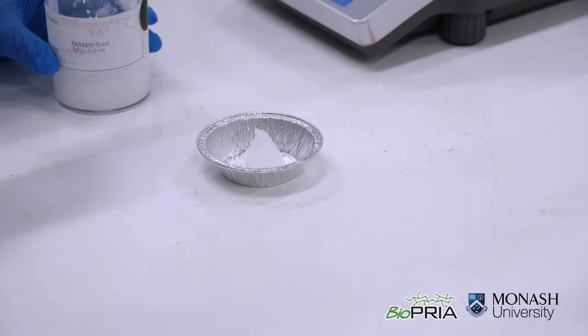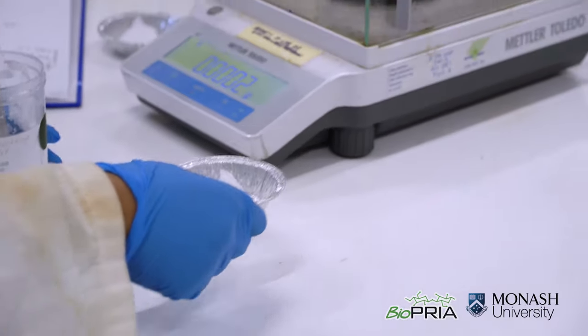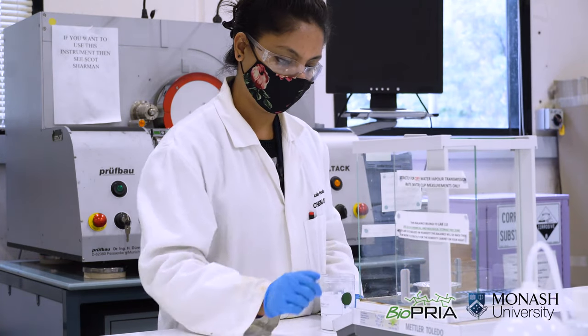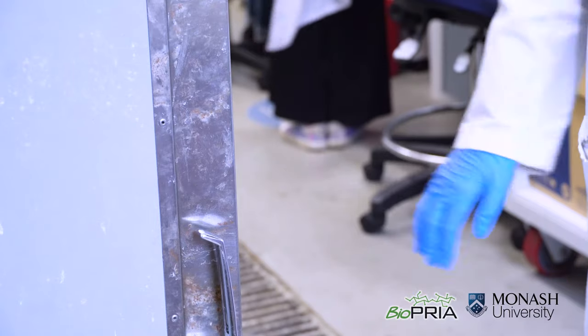We need to take a few grams of the fibers to quantify its solid content. We normally do this by gravimetric analysis, that is by taking the mass of fibers before and after oven drying overnight.